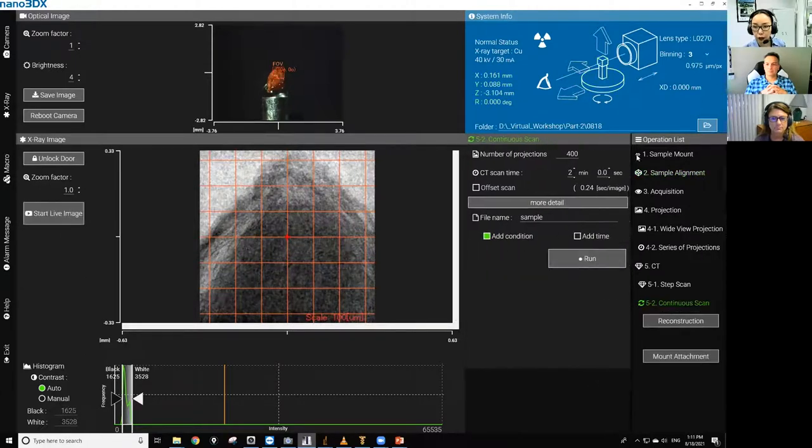And let's do a scan. And you guys want it. Actually, it was a split, but Tom chose three. So I'm gonna do 3x3 and 400 projections in 2 minutes. And let me just give a name. And run the scan. So this will take 2 minutes plus alpha to save the data.